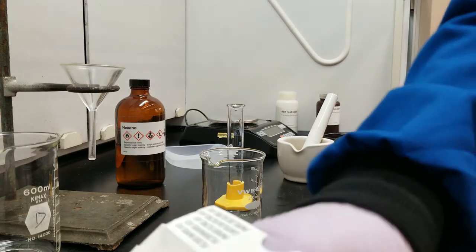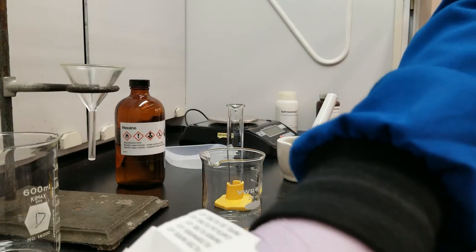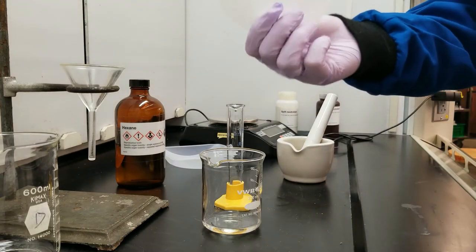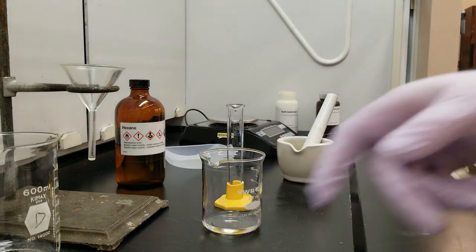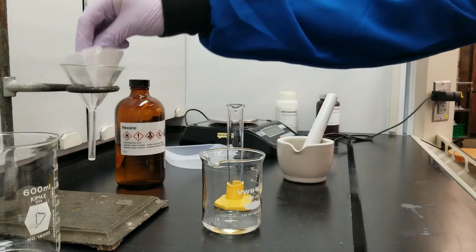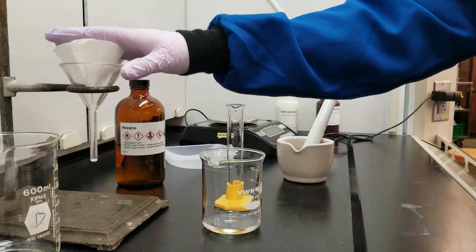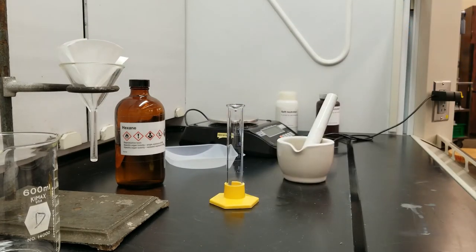Once I'm ready to filter, I'm going to need to use a filter paper. We're going to do something called fluting the filter paper because the filter paper is large and flat and doesn't fit very well in my funnel. But if I use a fluted filter paper, which means just that it's folded in a way that's convenient for my funnel, then I can use my fluted filter paper in my funnel apparatus.